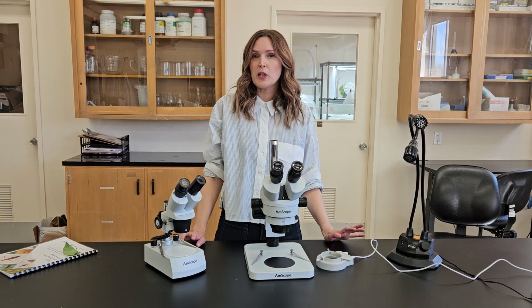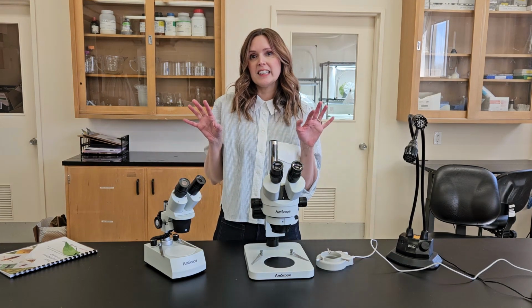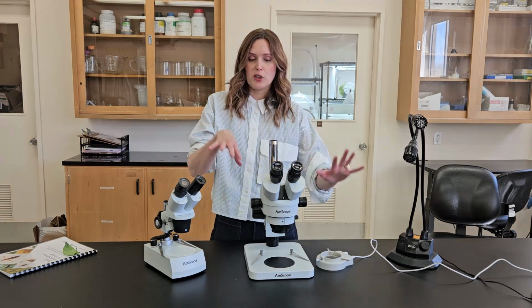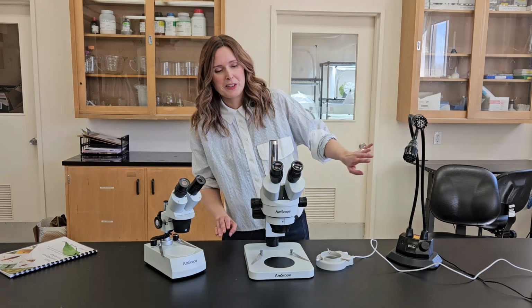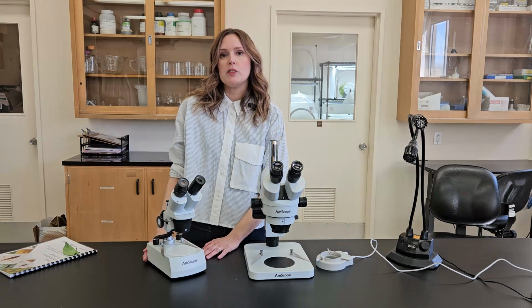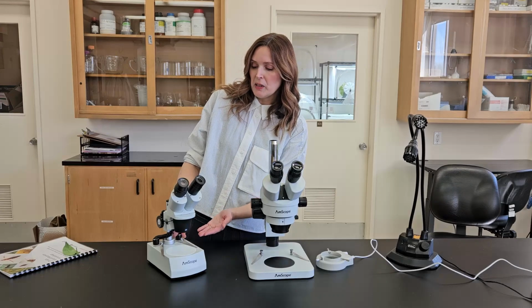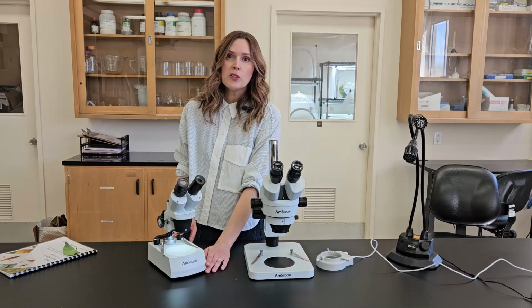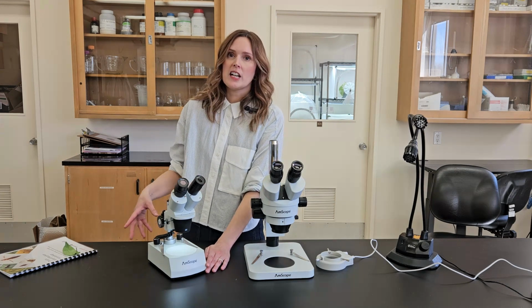So the next feature we're going to talk about in terms of user experience and what you should pick is light source. There's pros and cons for the cheaper microscope and the more expensive one. We've gotten rid of our very expensive lab microscope because we know you're probably not going to buy that. So this one from Amscope that we've been using for a lot of our workshops, the light source is built in. And the other benefit of this is it's actually rechargeable. So we plug this in before, and now we can use it without a cord getting in our way.